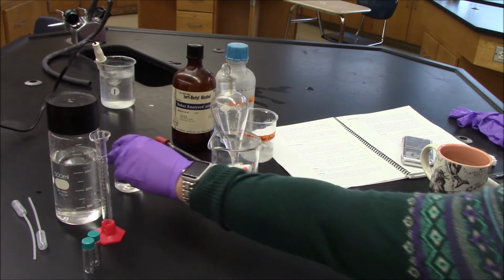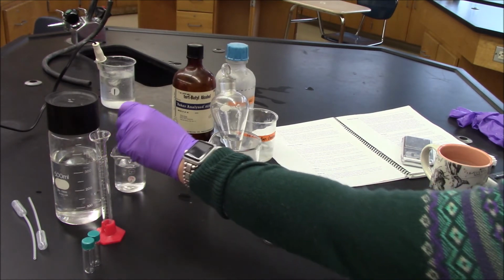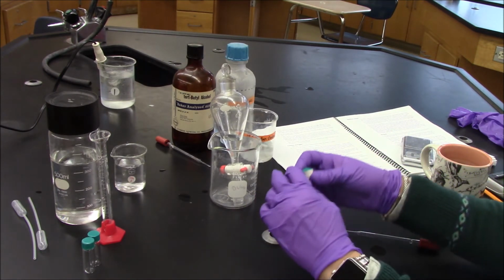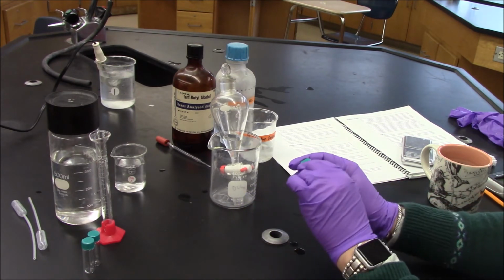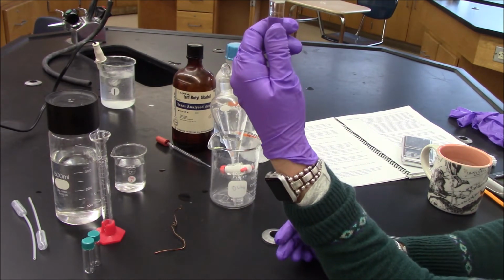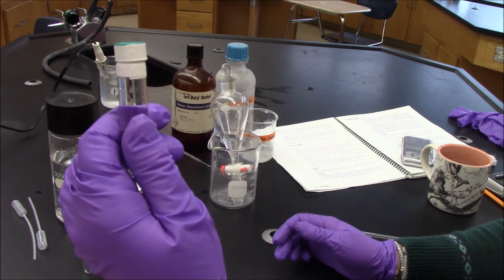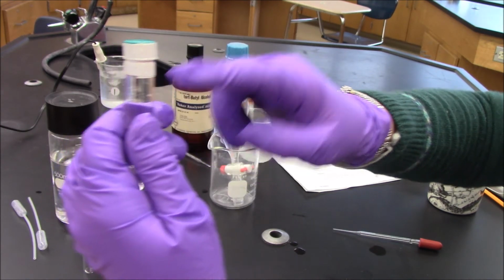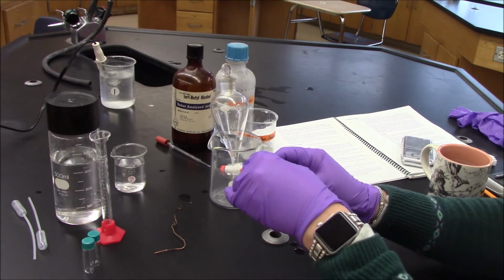Here we go. So again, I'll undo the clamp handle. Let's see how I do here. Probably should have a paper towel. Okay. I will carefully observe my contents. I'm going to look closer to you. I'm hopeful that maybe you can see that there are 2 distinct layers here. I will take off the Teflon tape.